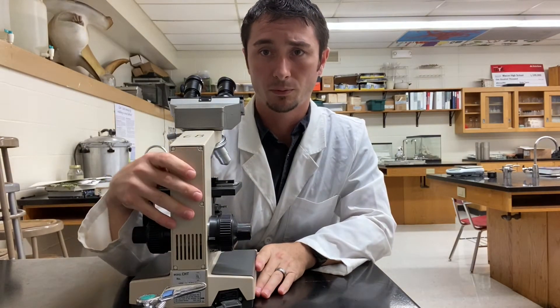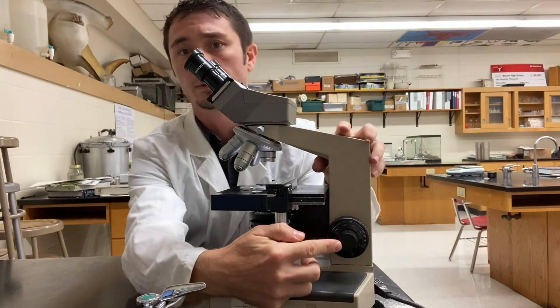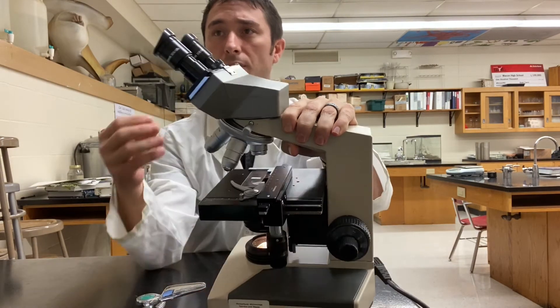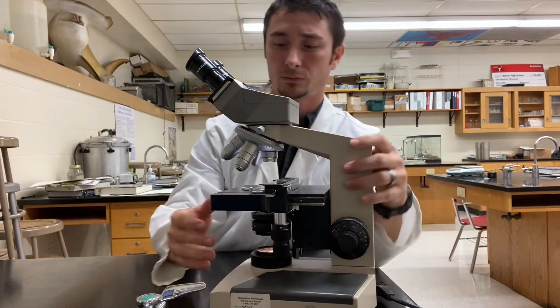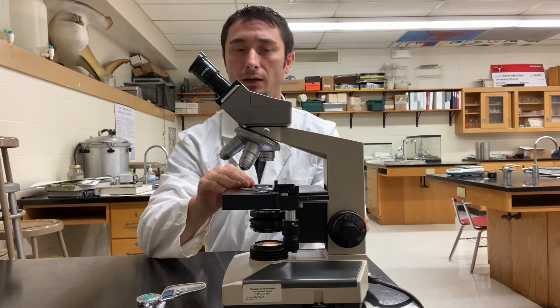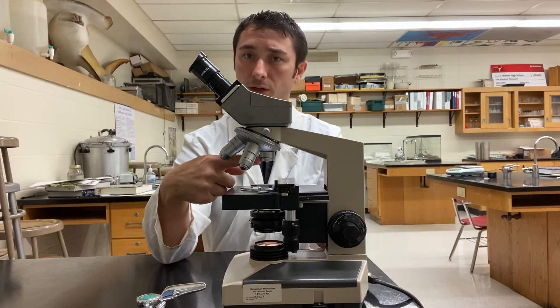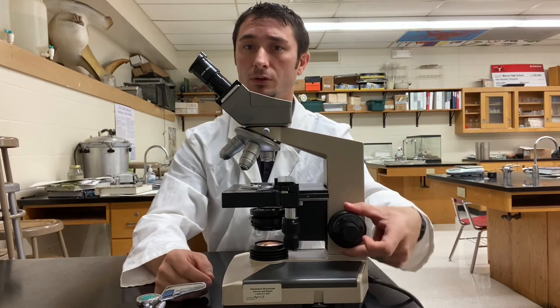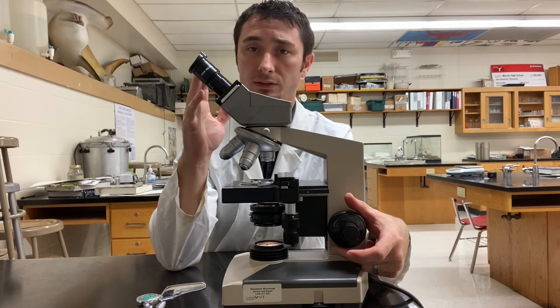Some other important details as you start using the microscope: the fine focus and the coarse focus, which are these knobs right down here. There's a small knob and a big knob. The big knob is the coarse focus — coarse meaning large, granular movements. The tiny knob is for fine movements. When using this microscope, you always want to start with the stage all the way down. Take your coarse focus and make sure it's down before you put anything on. Always start with your lowest objective lens, which is the 4x.